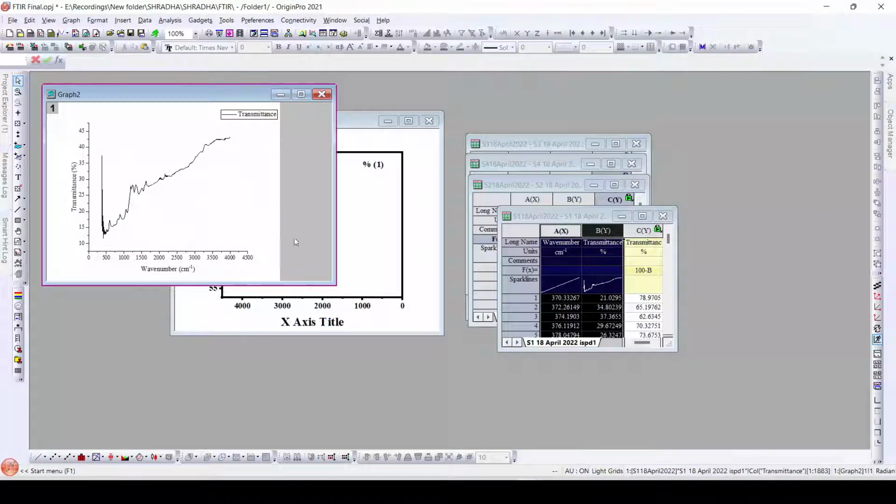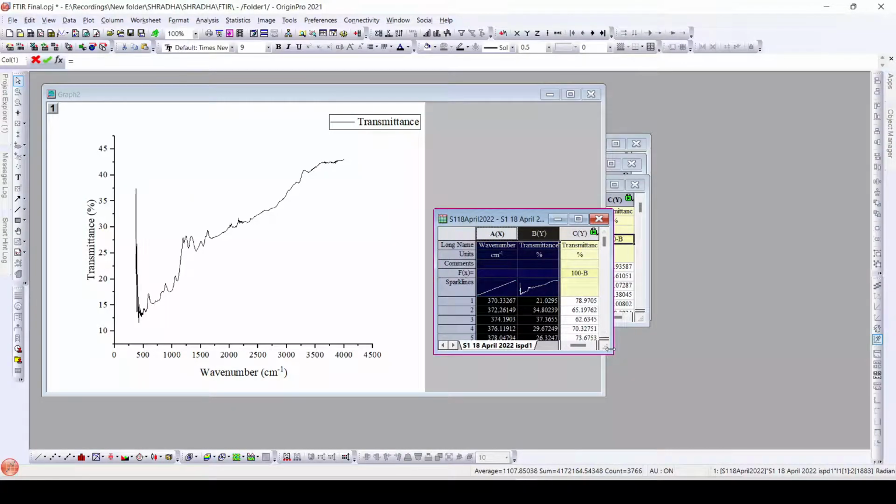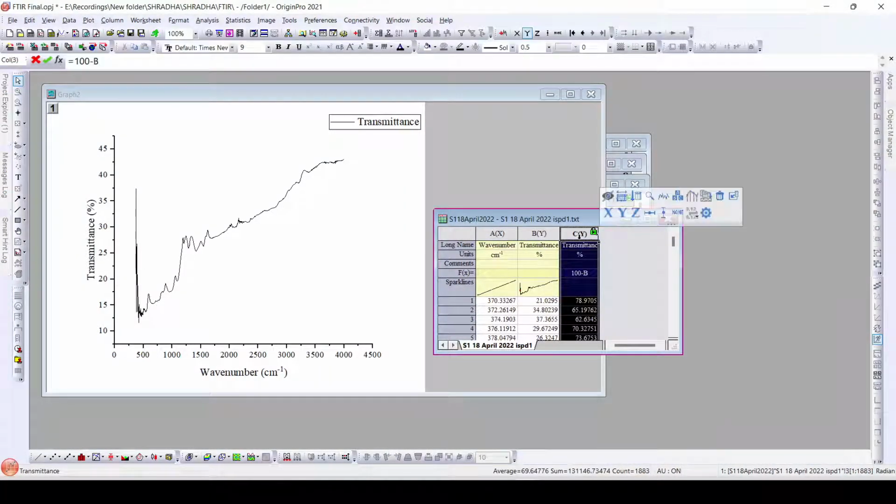Particularly this data has some problem, that is, though it is transmittance, it is given as absorbance. So we first need to convert it to transmittance. Why am I saying so? Because, as we can see, the peaks are reversed, and the value here is around 10, which should be around 100 if it is transmittance. So in order to convert it into transmittance data, we need to subtract it from 100. So we did it here, and now we can use this data.